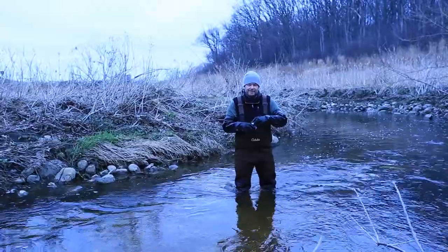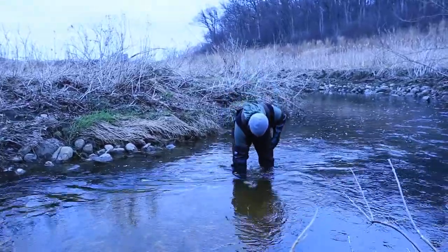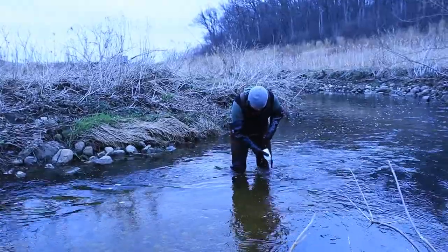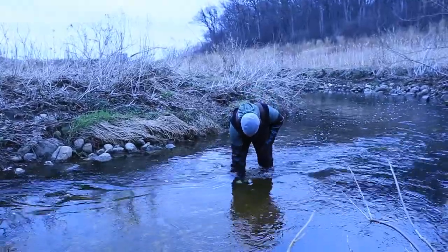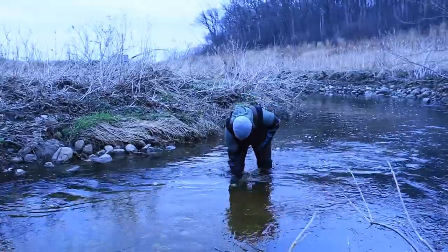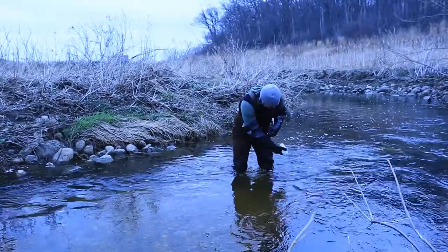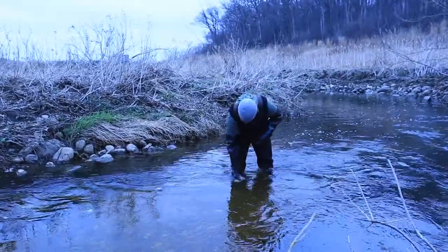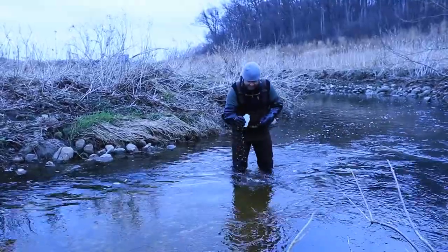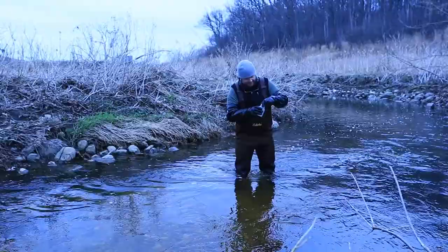Next, we take our grab sample. These bottles are sent to our partners at the Wisconsin State Lab of Hygiene for chemical analysis. We ask for the lab to measure the concentration of chloride in the water, as well as other ions such as sodium, calcium, sulfate, magnesium, and others.